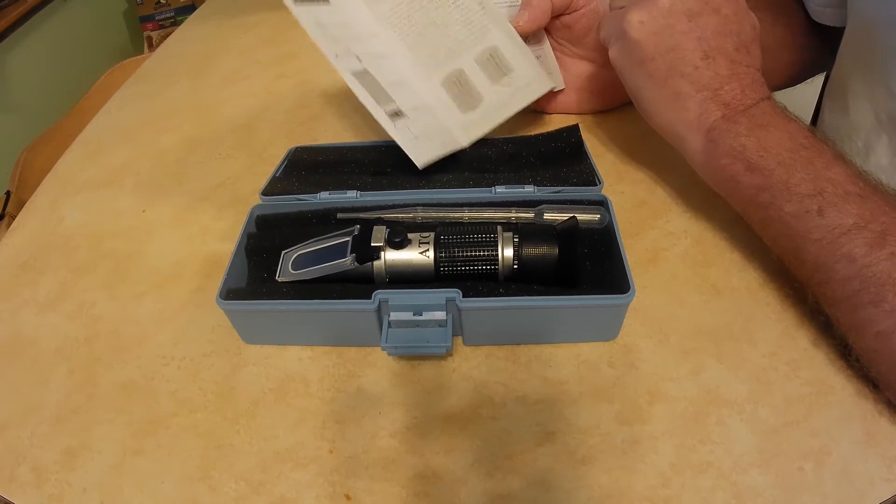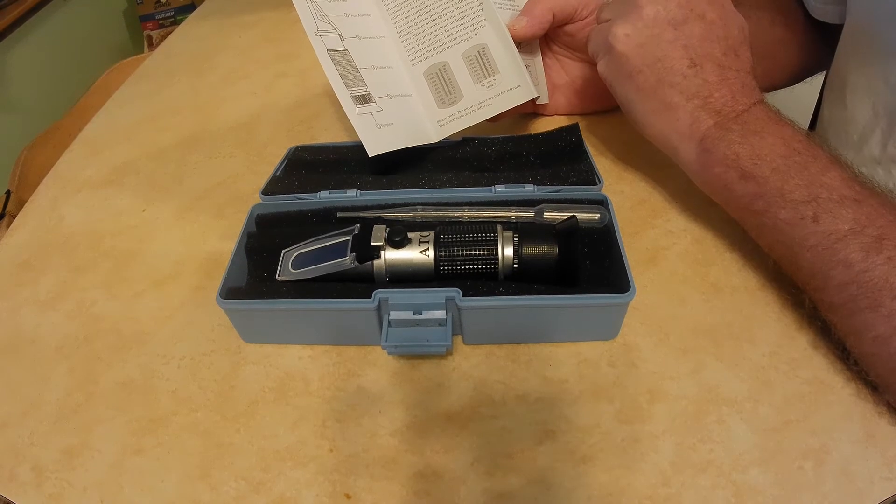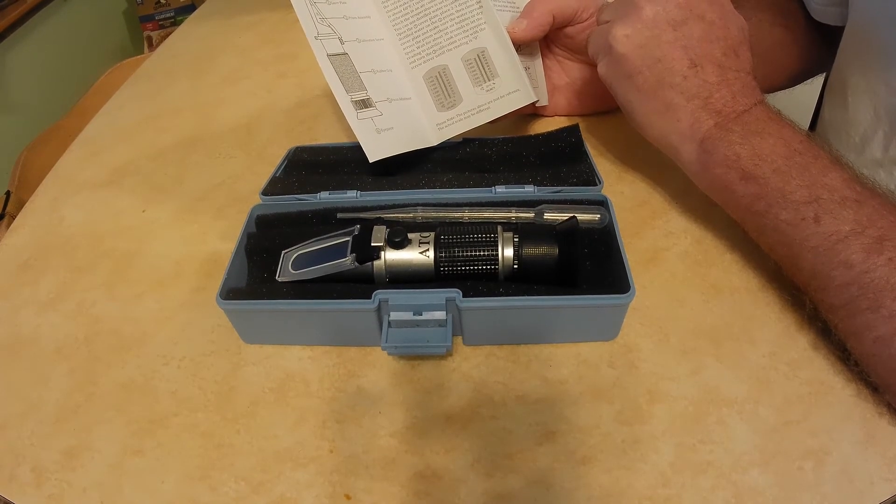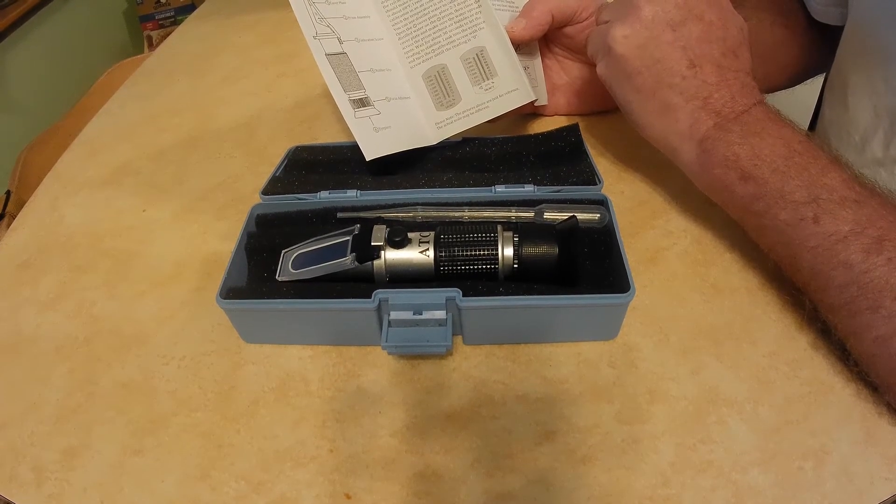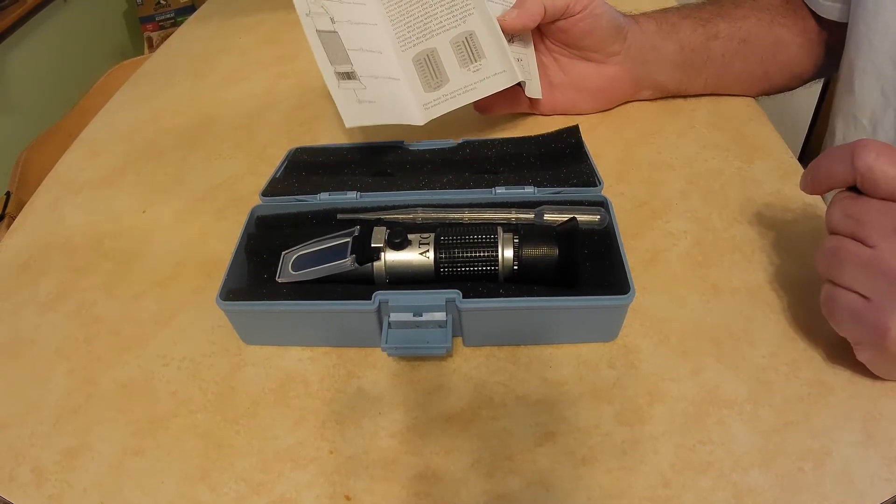Well for a honey refractometer that's not right. I tried to calibrate it with distilled water and I never got a reading of any kind. So I might have messed up the settings of my device.